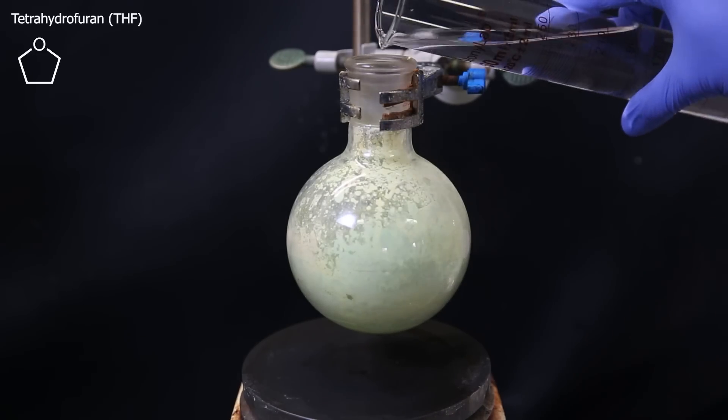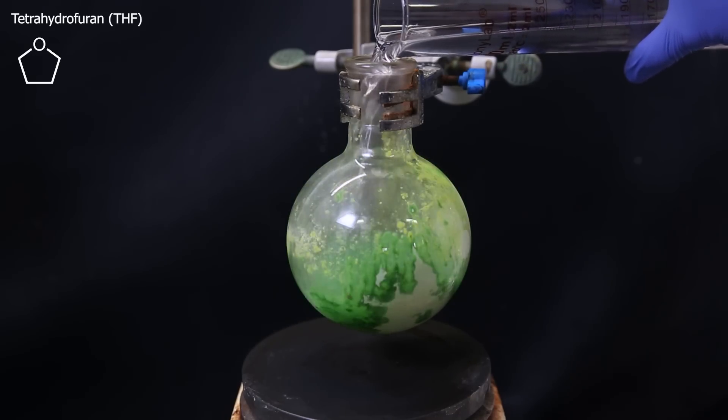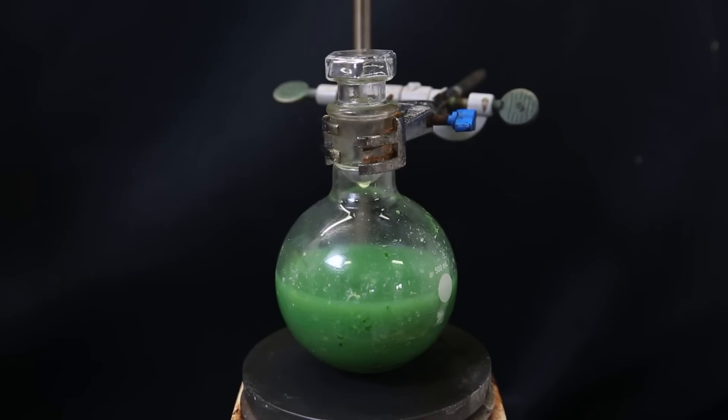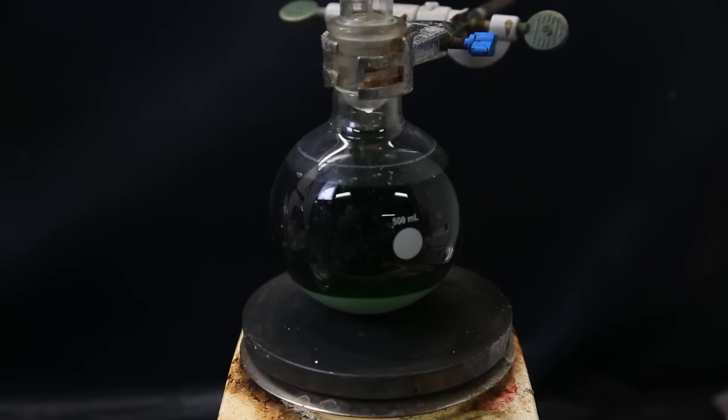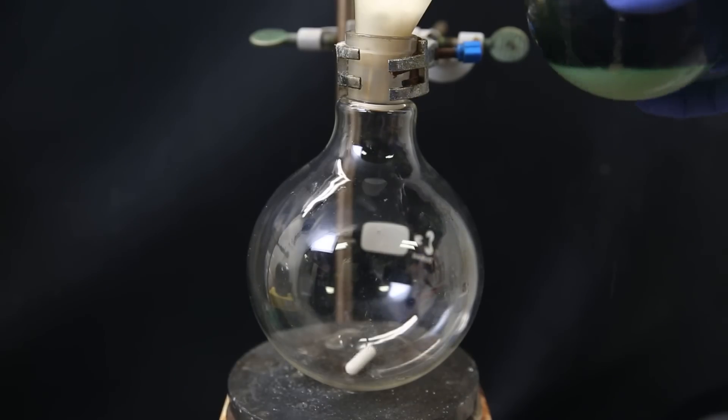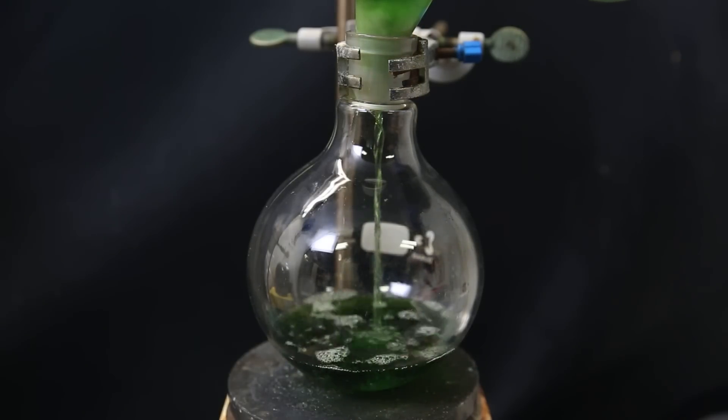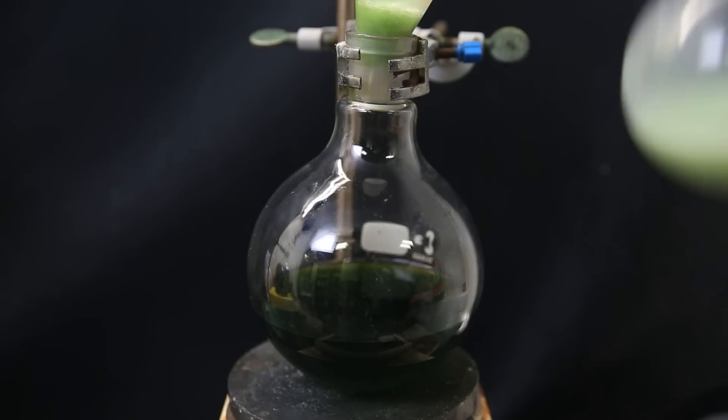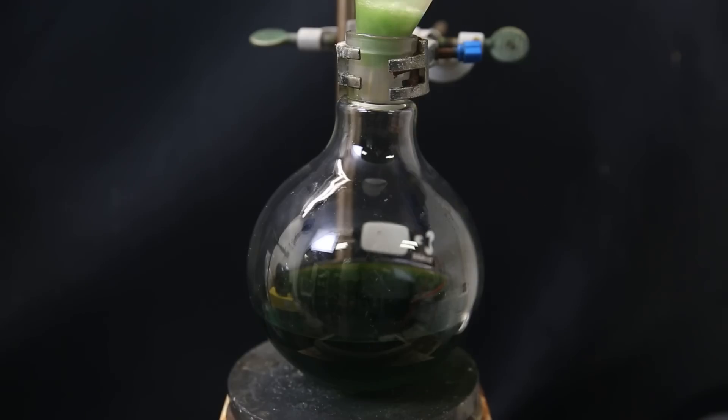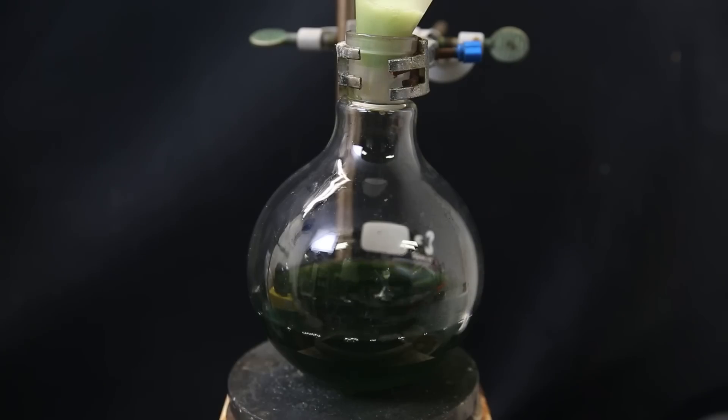Anyhow, I just dissolve all of the uranium tetrachloride into the solvent tetrahydrofuran, in which impurities should be insoluble. I shake it and then let it stir for a while, and I also added some more solvent. After letting it settle, all the impurities sink to the bottom, and all the uranium tetrachloride should be dissolved, giving a very dark green solution. To remove the settled impurities, I decant it carefully into this flask while filtering it through some cotton. I wash the flask with some more solvent, and the settled white solid definitely doesn't dissolve. It seems those tiny particles pass through the cotton, so I just continue with what I already have, since it settles so slowly.